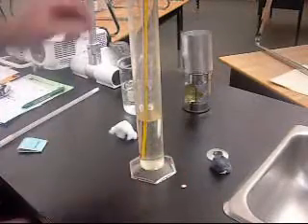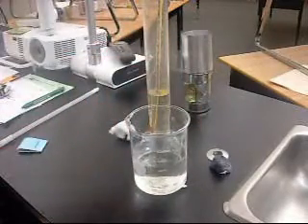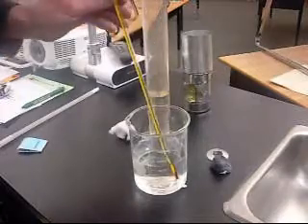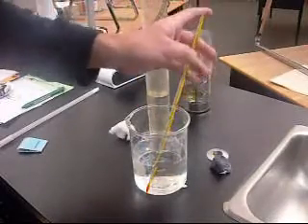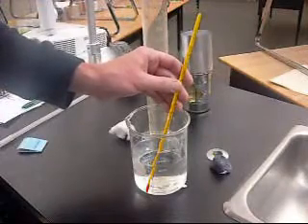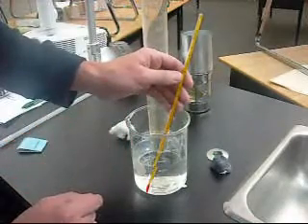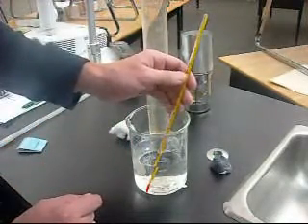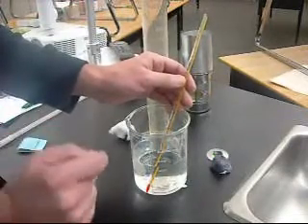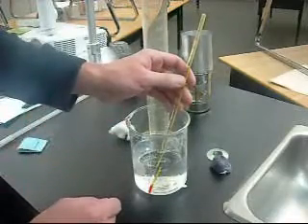So here's a trick. Since you have about 4, maybe 500 milliliters of water, you can save yourself some time by getting an initial reading. Place your thermometer into your 500 milliliters of water and wait until the alcohol, the red line, goes as high as it can go. Once you have that, you can use it as your initial water temperature for all of your tests in one sample. Okay?